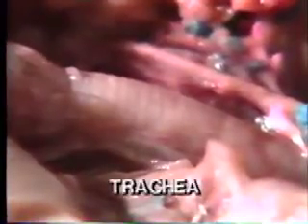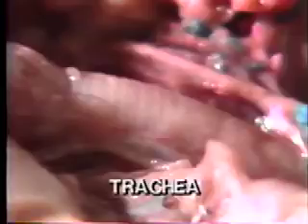Behind the larynx, air enters the trachea. The trachea is reinforced with rings of cartilage that keep it from collapsing. In this photomicrograph of a cross-section of the trachea, the cartilaginous rings are stained purple. A highly magnified view of the trachea shows that it is lined with ciliated cells. The cilia trap mucus and foreign particles and continually move them back to the oral cavity.